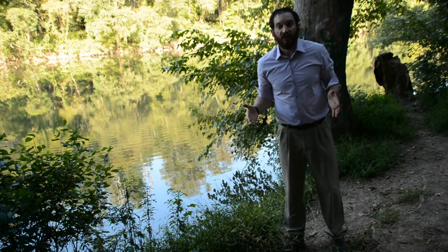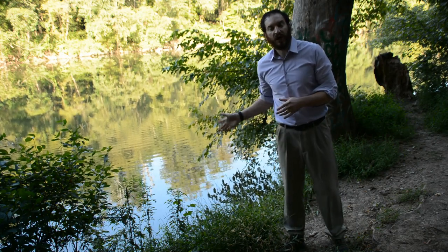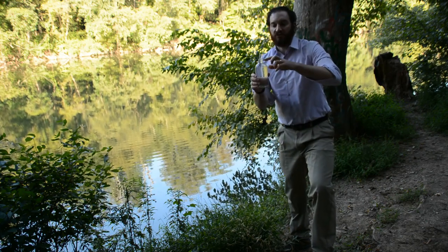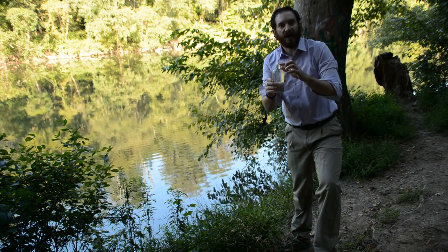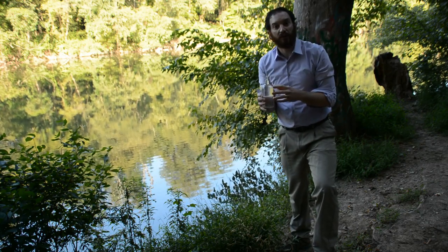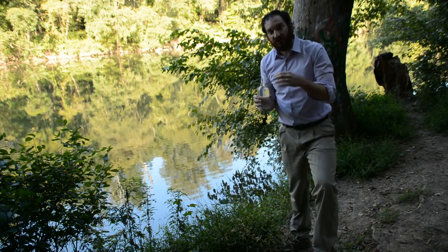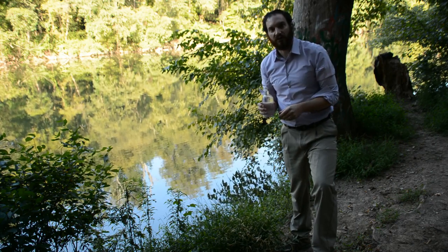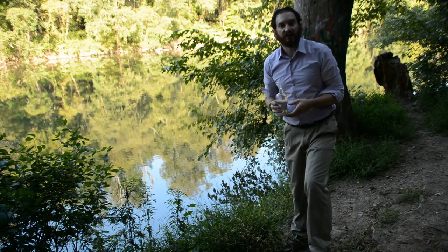All right, so now what I've done, I've gone and filled up my sample bottles. I filled them when they were underwater. As I filled them, I made sure that the water was all the way to the top, and we use these little plunger type toppers so that they seal off all the water and don't let any air bubbles inside. It's really important that I don't have any extra atmospheric air. Both of these were filled the same way. Now I'm going to tie them off to our rig, and I'm going to put the rig in the water, and we'll come back and get it tomorrow.